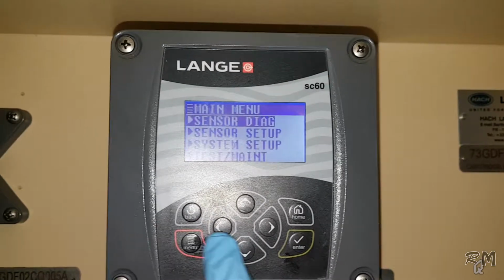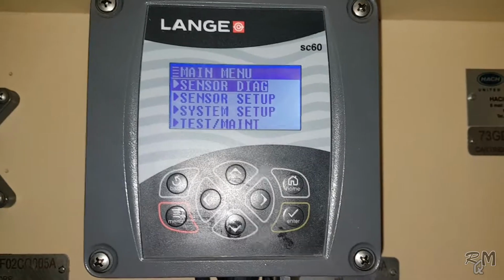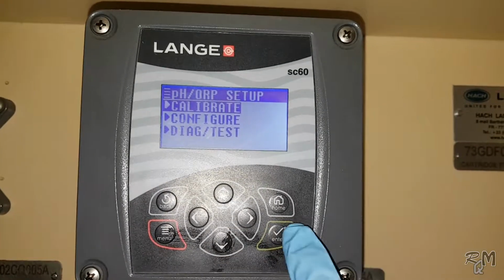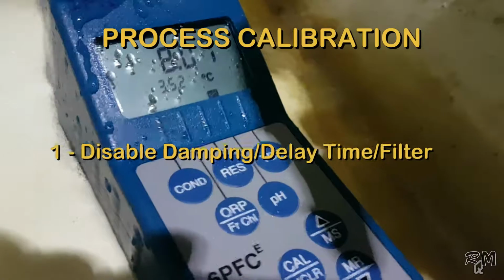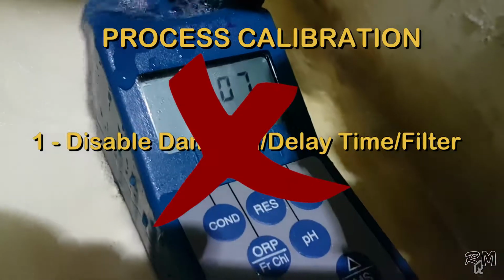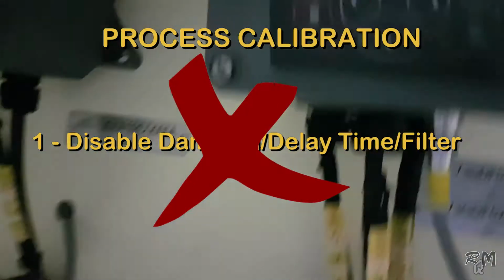Okay, now I show you basic steps of process calibration. These steps are common for any pH analyzer. Only there will be difference to access calibration menu, which you can easily get from user or instruction manual. In first step, if analyzer damping, delay time or filter time are active, then deactivate these parameters or make these 0. This will make pH probe more active and more efficient, which is required for calibration.